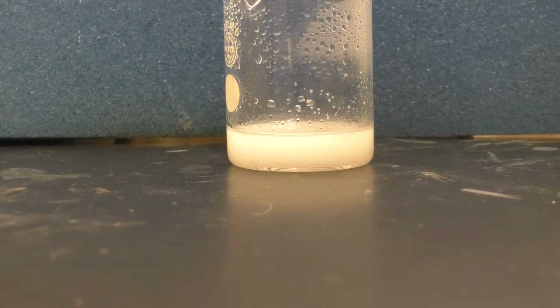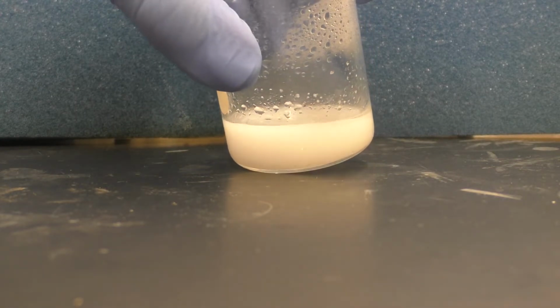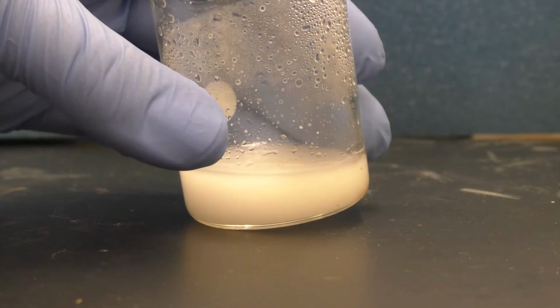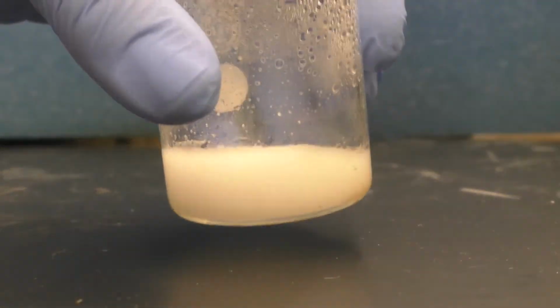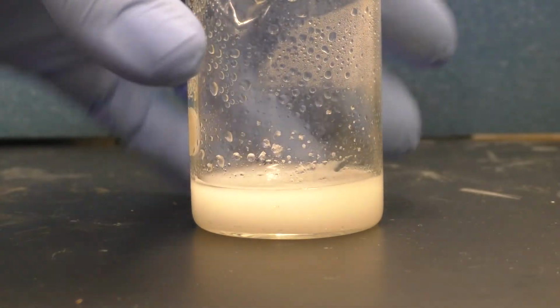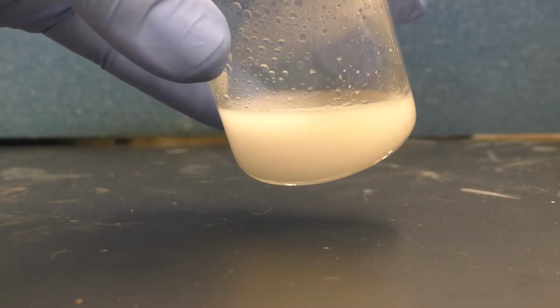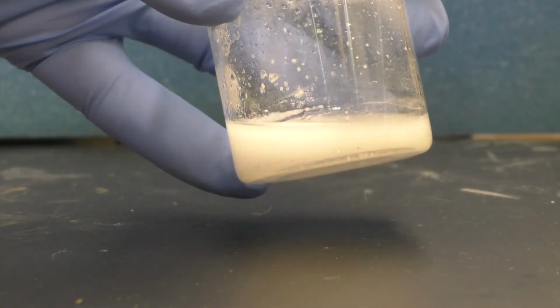Unfortunately, rather than getting a good recrystallization, what we have instead is a case where the product oiled out. So here you see it's cloudy, not really much in the way of solid material, and it may be difficult to see, but there's some oily material around and along the bottom of the flask. This is probably due to having the hot plate pretty high, and some of that material melted. It got above its melting point. Aspirin melts at a lower temperature than the salicylic acid. So it melted and then formed an insoluble layer or bubbles within the aqueous layer.